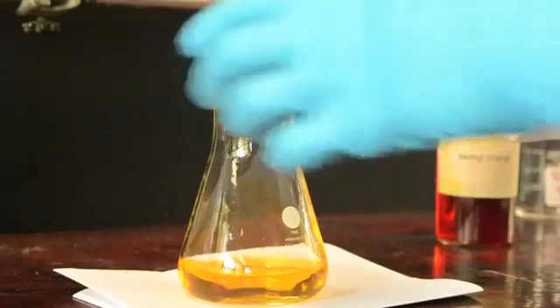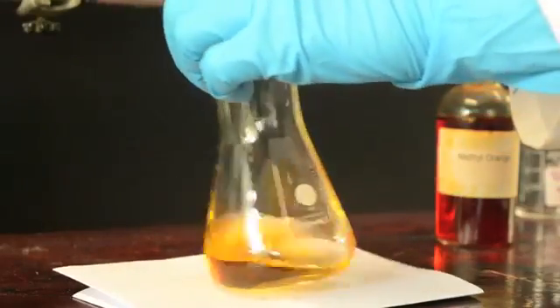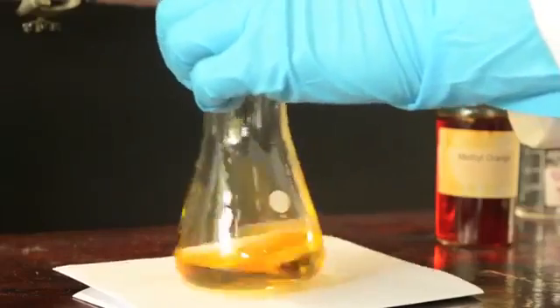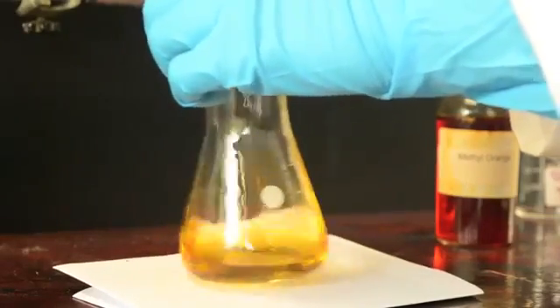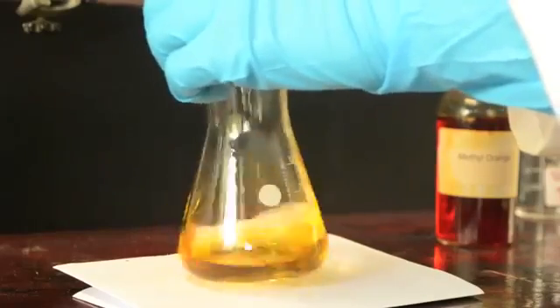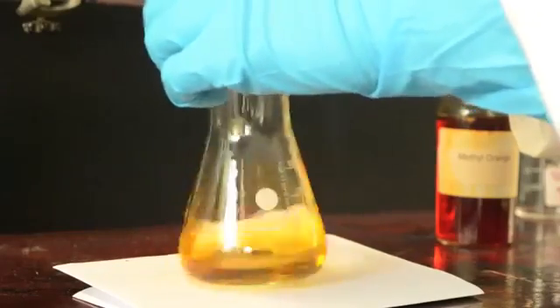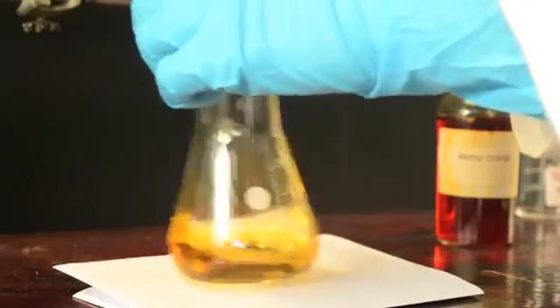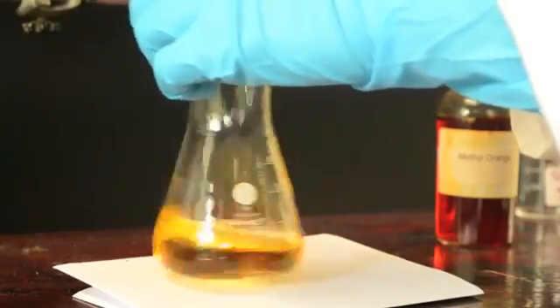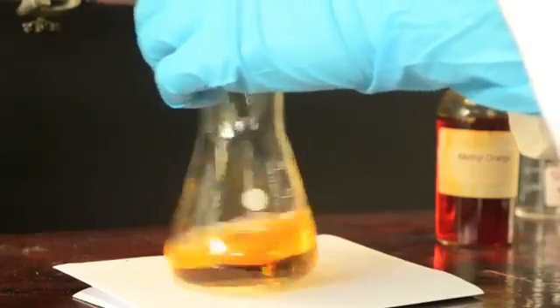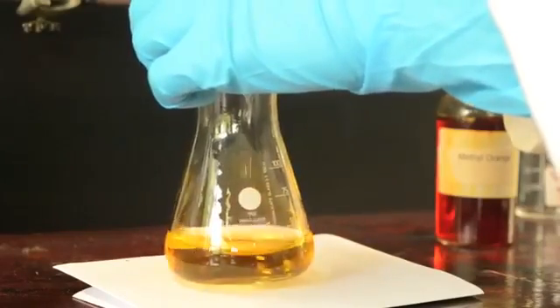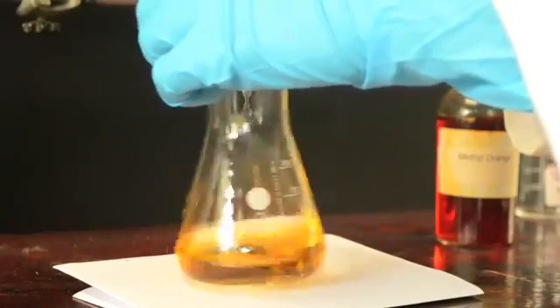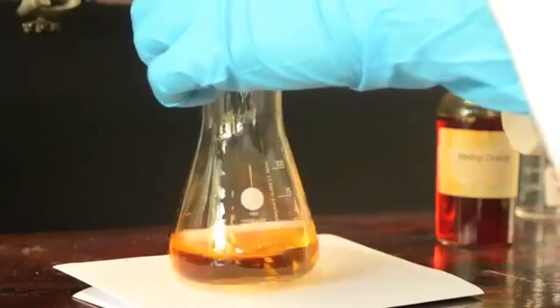I'm going to add hydrochloric acid solution from the burette to the conical flask until I see a color change. I do this while swirling the conical flask because it's important that all the acid mixes with the base as it goes into the conical flask. So swirling all the time and adding in a slow drop-wise manner until the point where the solution remains pink.